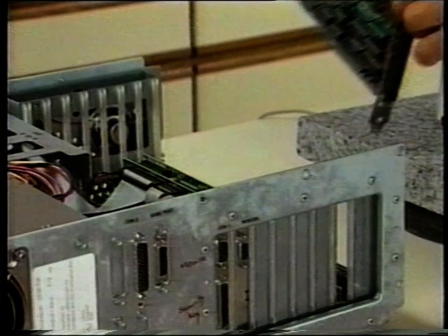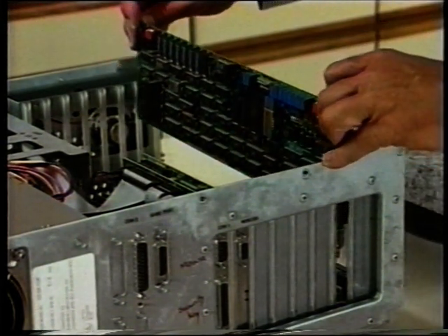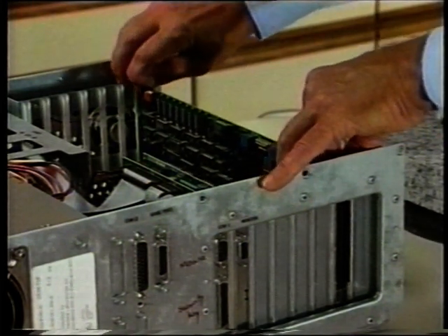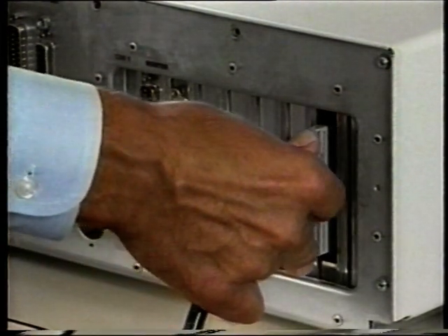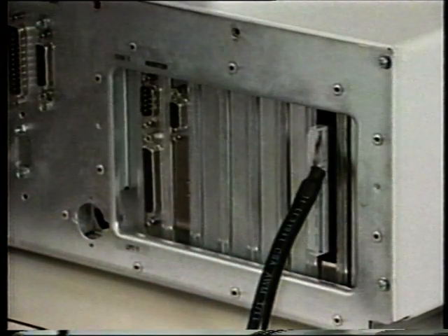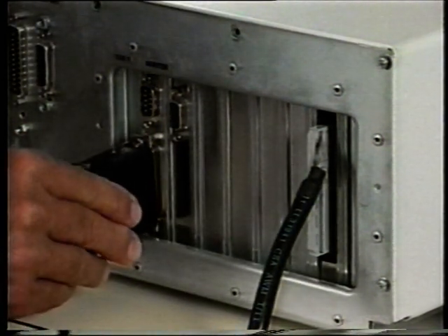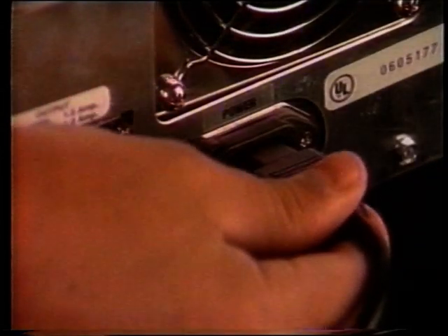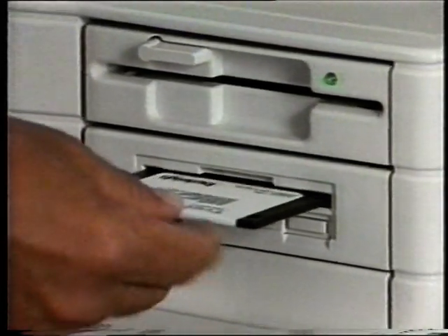Install the ADA 3100 data acquisition card from Real Time Devices in any available slot in the computer. Follow the instructions supplied by the manufacturer. Connect the control electronics to the computer with a ribbon cable and install the security key in the LPT1 port. Without the security key, the software will not run. Attach the power cord, turn on the computer, and install the True Image software.